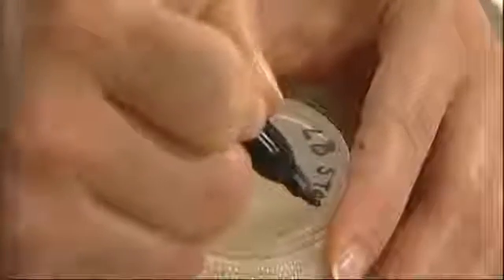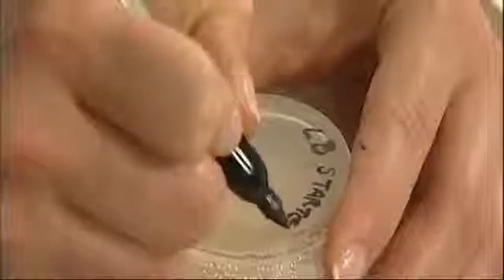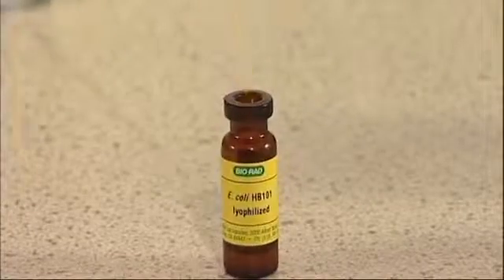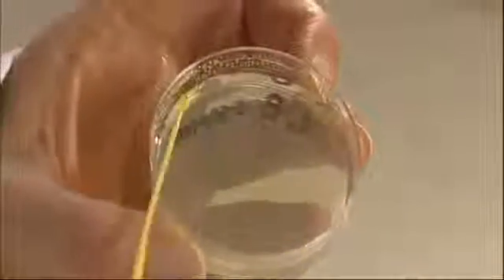Meanwhile, label eight LB plates 'starter.' To streak the starter plates, take a fresh inoculation loop and dip it into the rehydrated E. coli. Run the inoculation loop over the first quarter of the starter plate.